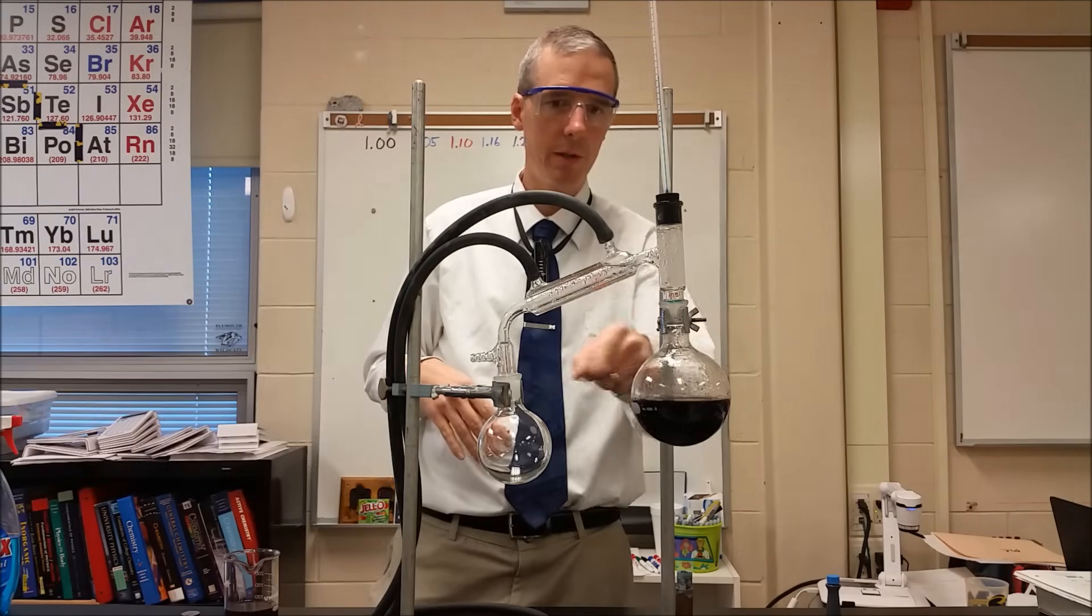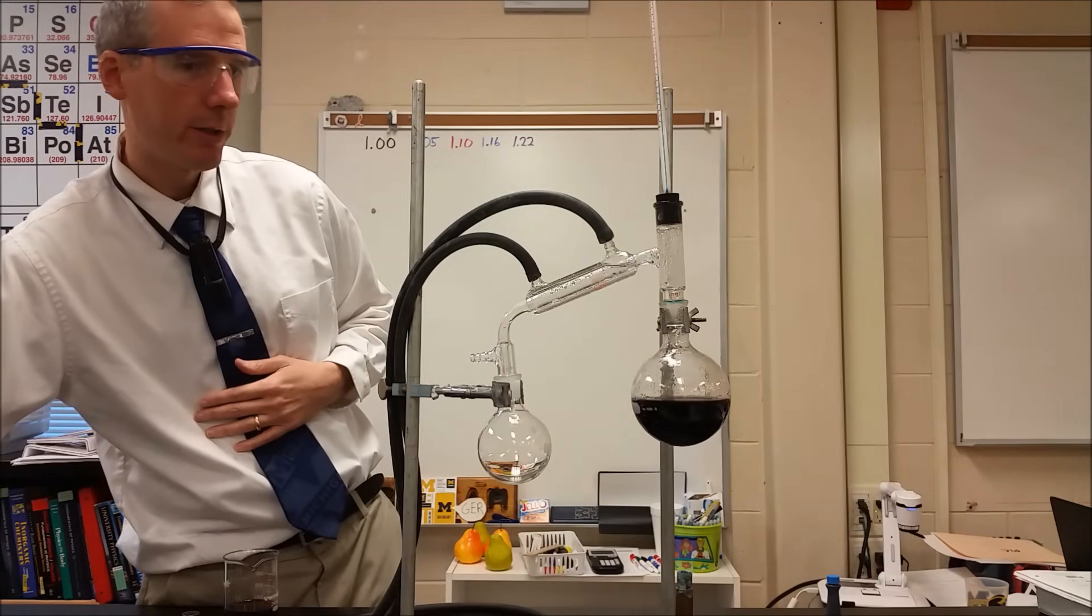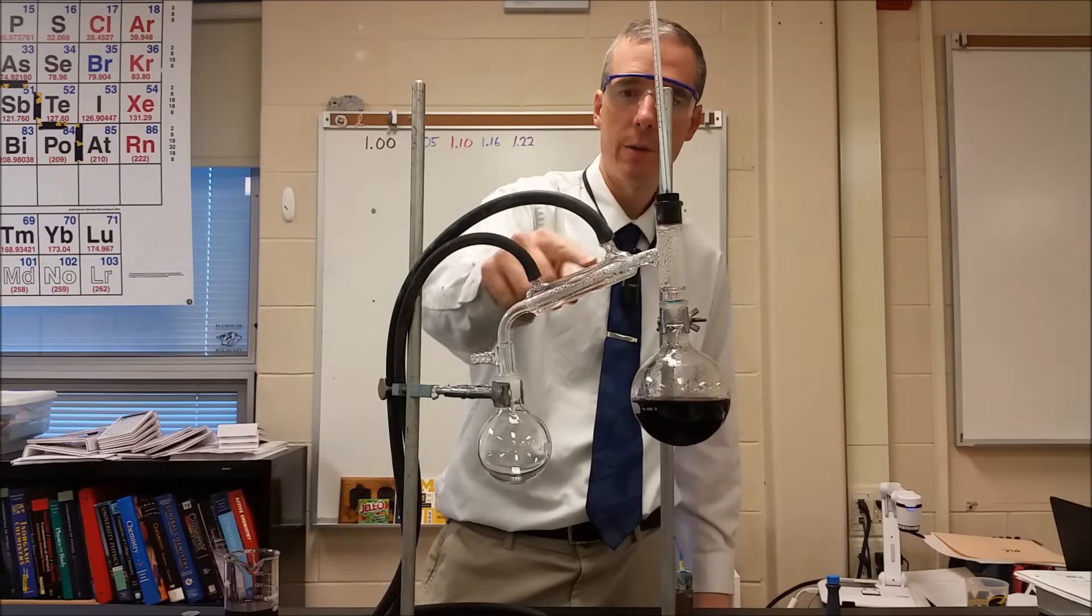So what we're going to do is heat up this liquid solution over here. And then as we do that, we're also going to turn on the sink. So now we have water flowing from here through up into here.